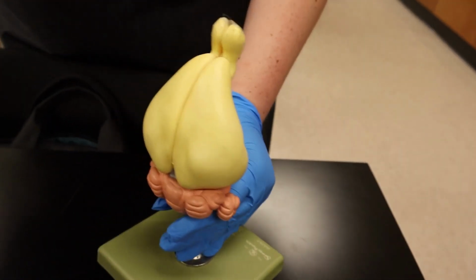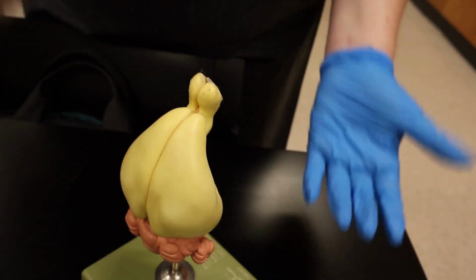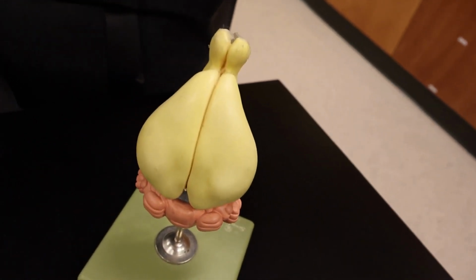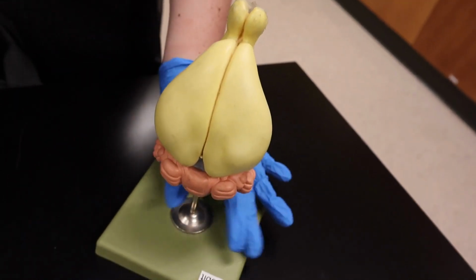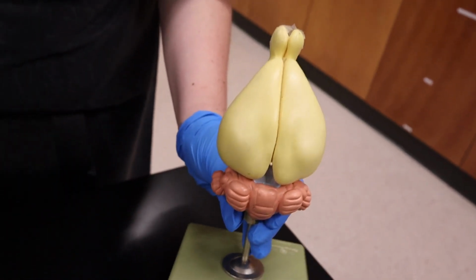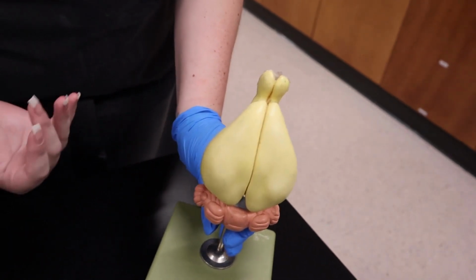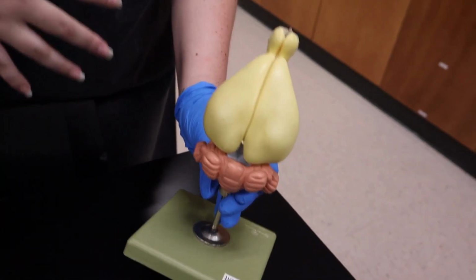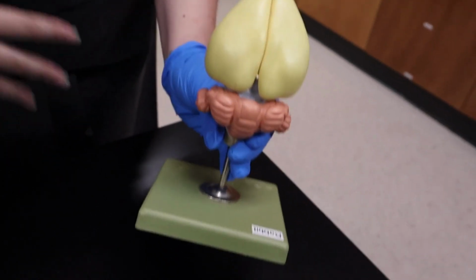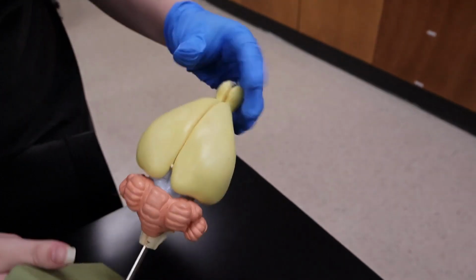Okay, so this is going to be our nervous system. The nervous system consists of the sensory organs that we just talked about, being the eyes, ears, etc. And then the brain is also going to be the other part of that nervous system. So we will be cutting open the skull of the rabbit and showing you the brain inside of its cavity in the skull. But I am going to do a breakdown of the different parts of the brain and their different adaptations and what they are important to the rabbit for.